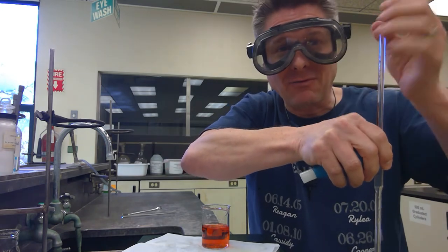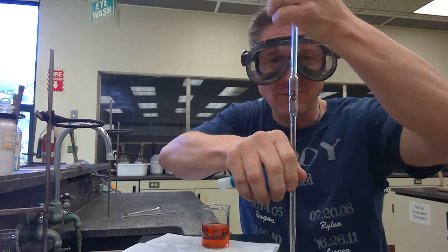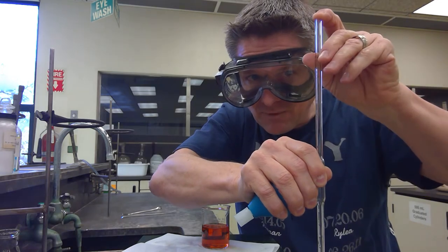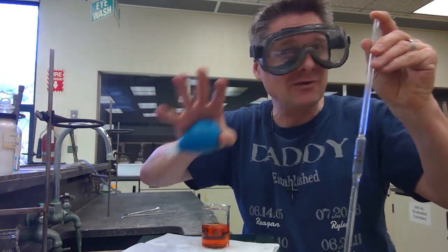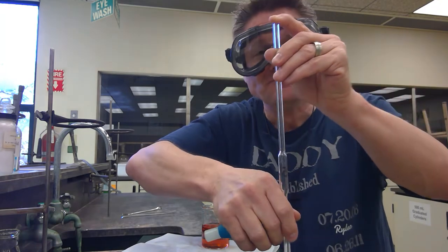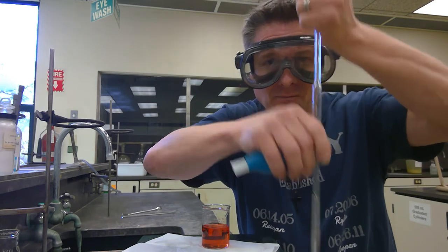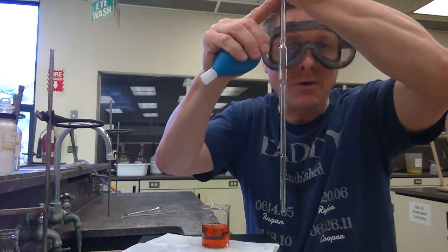I have a broken pinky and arthritis, so I pick the one that doesn't hurt as bad. So I've got the solution up there, and then I'm going to slowly roll my thumb — if you've got your finger, you're not just going to let go because it goes sailing down. You're going to find that sweet spot, like driving a car with a clutch where there's that one sweet spot. You're just going to roll your finger — for my case, my thumb — barely moving it, slowly releasing a little bit of air so you can control it where it drops down real slow. You don't want it to jump in big quantum jumps — you want a nice continuous one.